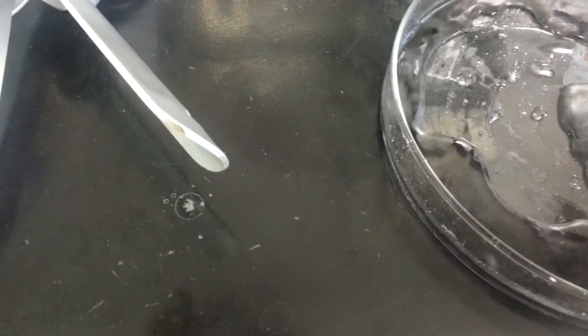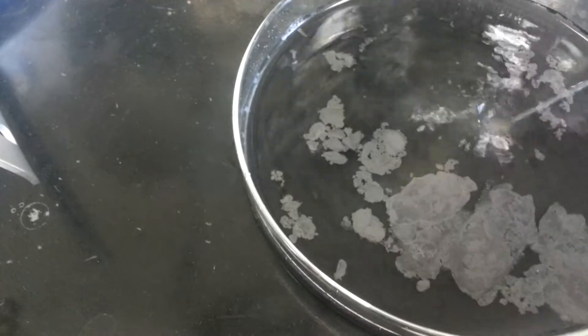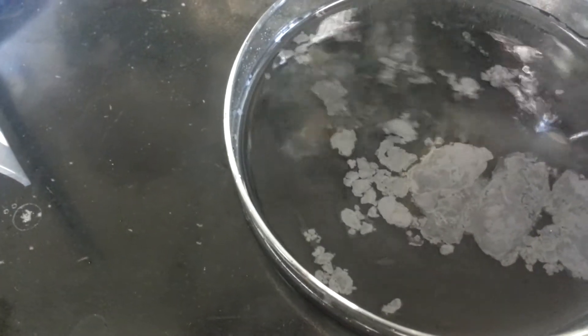But, let's try this. Fill the whole dish. Let's see what happens.